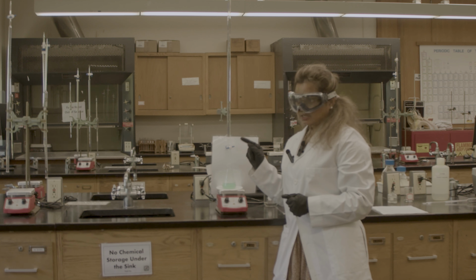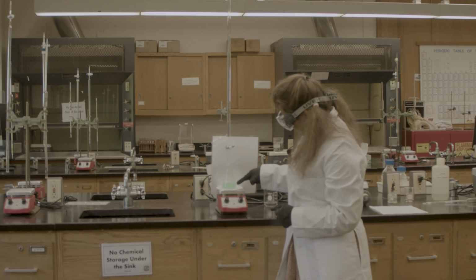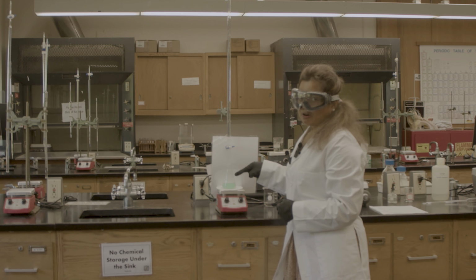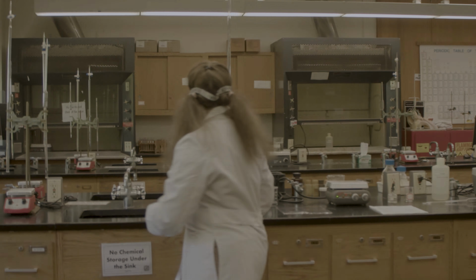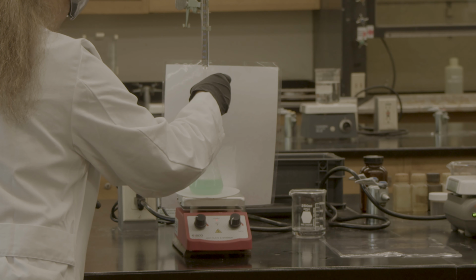That means as it is acid, it will get a purple color. You can see that for my antacid, it's a green color. It's hard to get the purple color endpoint, but you will get it. So I start my titration. I have my 50 ml of sodium hydroxide, and I'm adding it drop by drop.